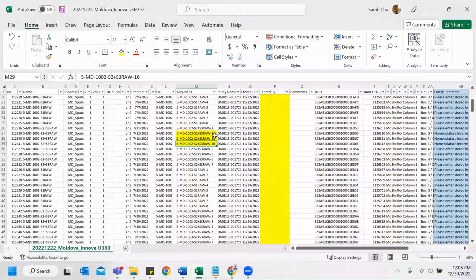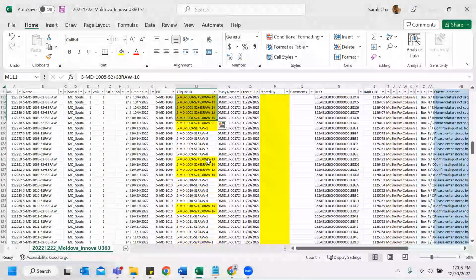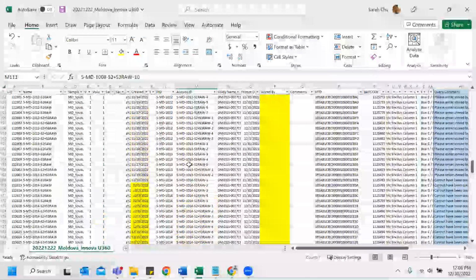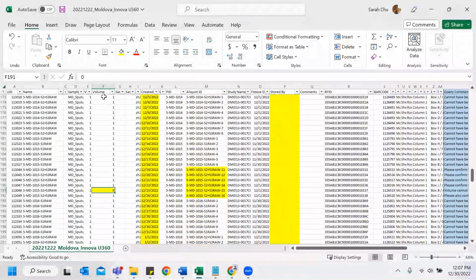Like this is very out of the blue. And then continues 10 to 16, 13 to 16. I highlighted it just in case. And for this volume, since initial volume can never be 0, I highlighted and made a comment right here.